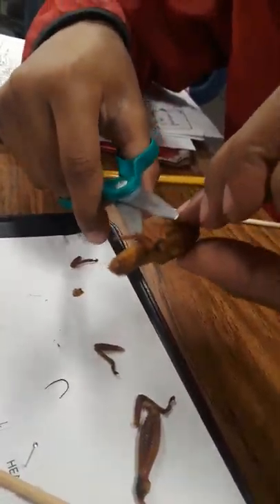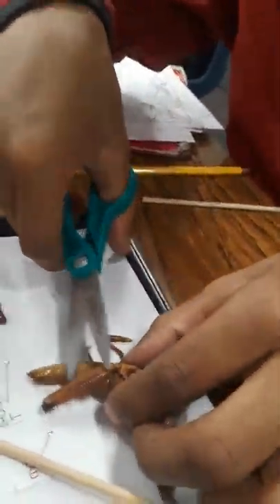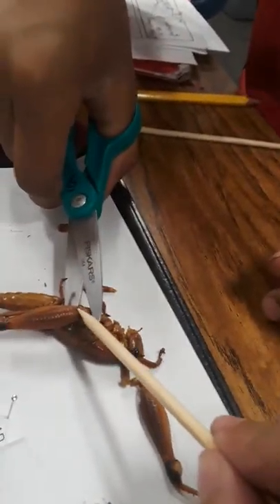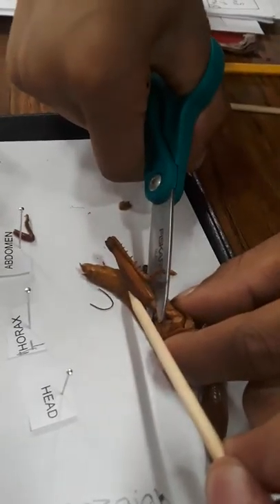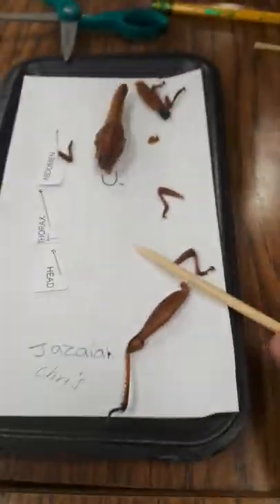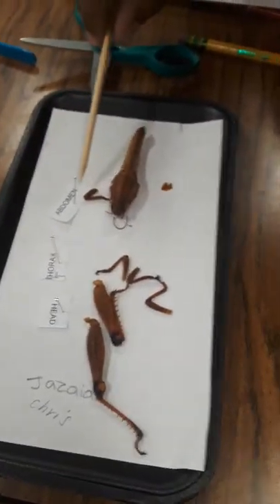Go. It's last leg. Let me just put it right there. Get it, get it. We got it all? Oh, God. One leg, two leg, three leg, four leg, five leg, six legs. Six legs.